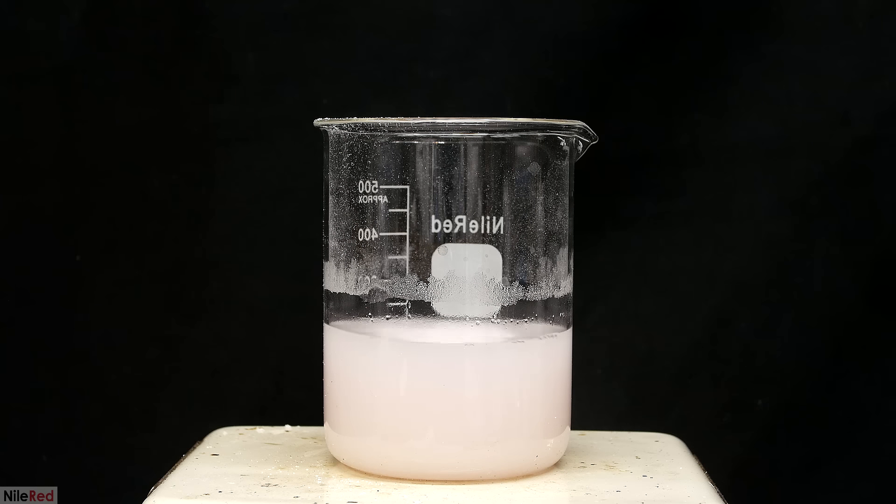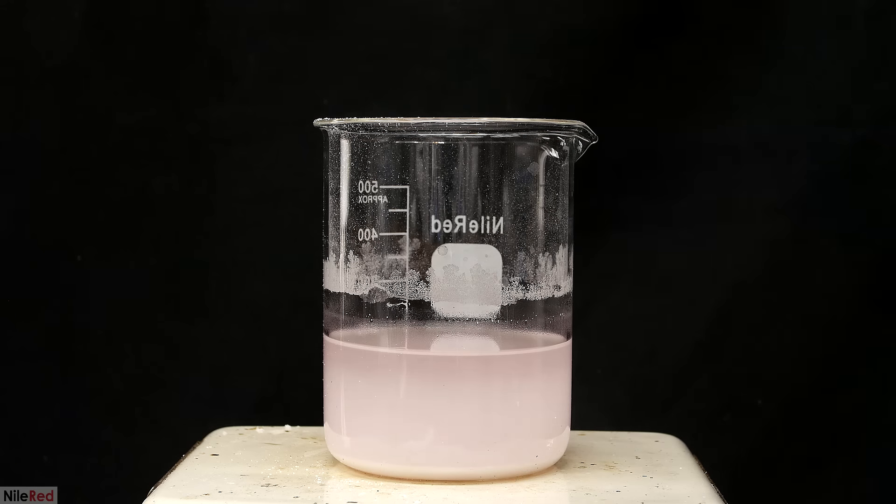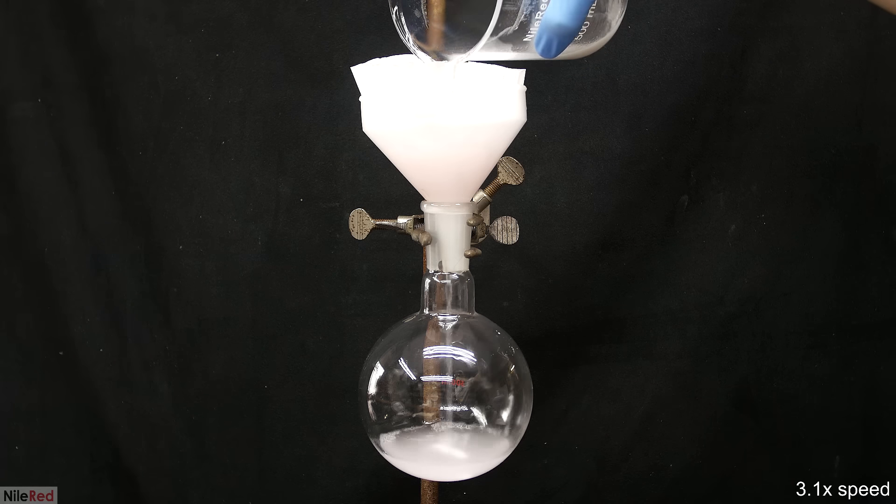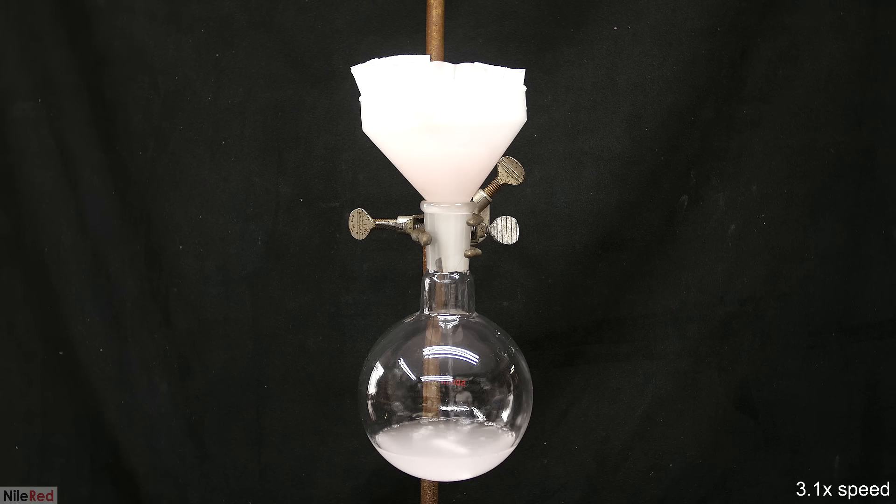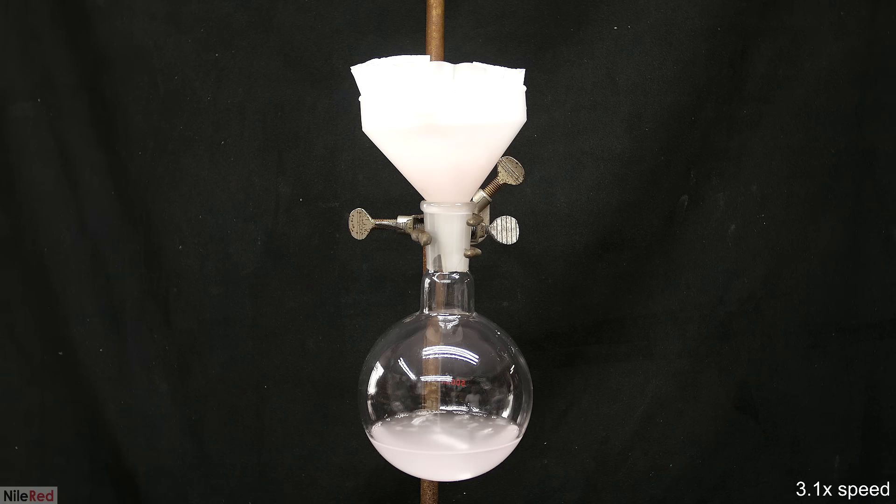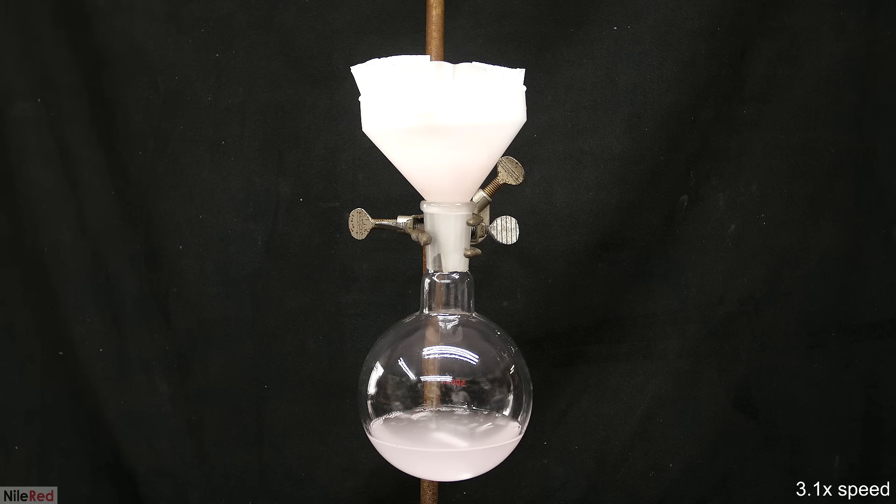Unfortunately, the dye that was used to brand the pills is also soluble in methanol, so the solution takes on a very slight pink color. At this point it's done, and I just need to filter off this insoluble stuff. It's pretty easy to do this, and I just quickly pass it through a coffee filter. Some of the particles are too small for the filter to catch, so the liquid that passes through is a little bit cloudy. This really isn't a problem though, and it's not going to affect the reaction.